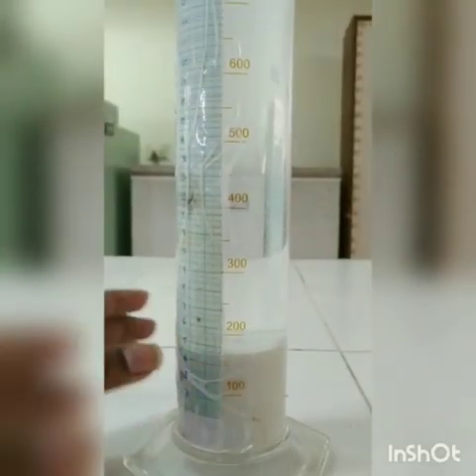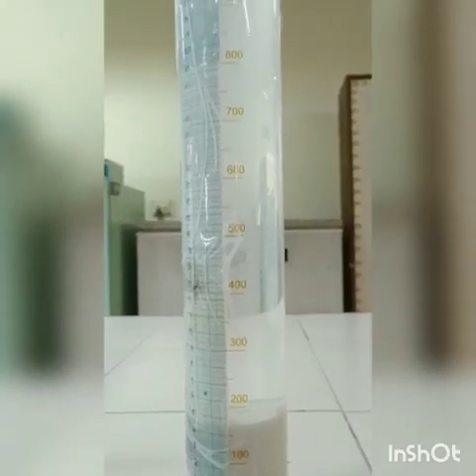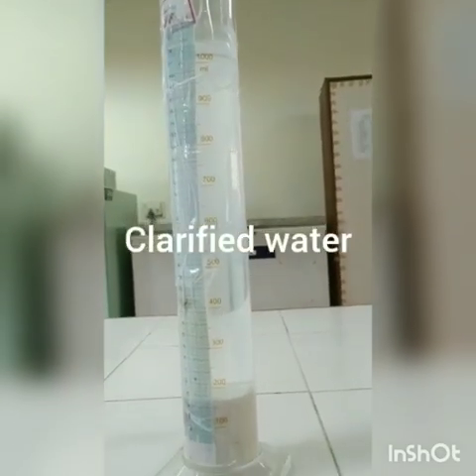So we need to plot the graph between the height of the zone at different time intervals after the immediate mixing of the lime into the water. Thank you.